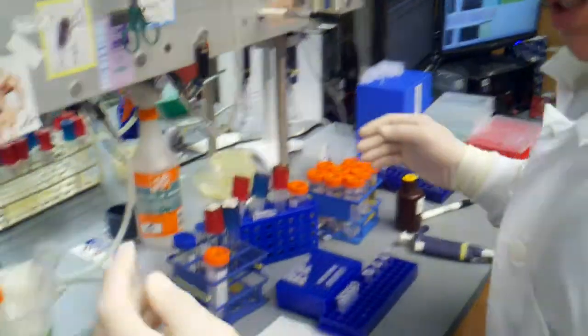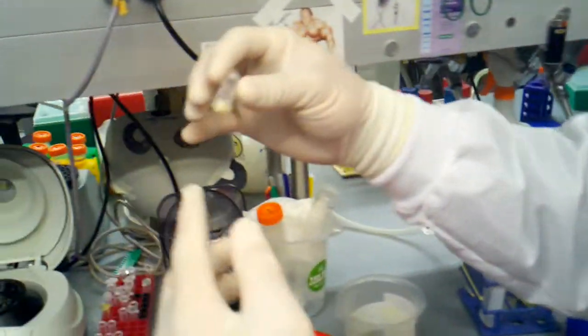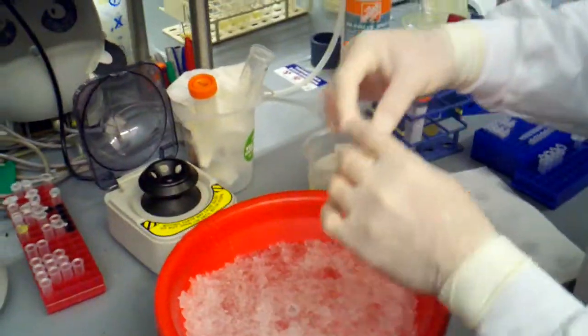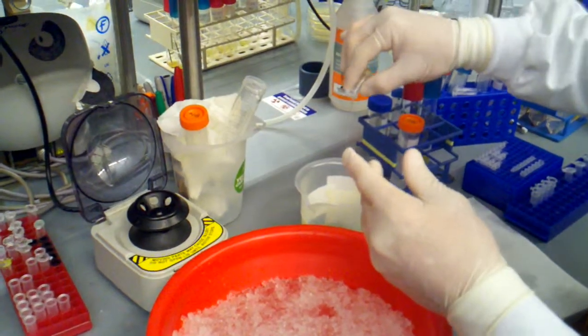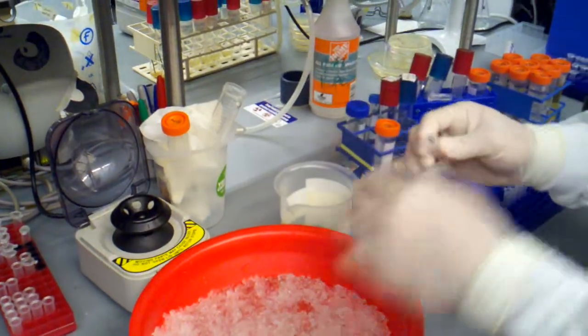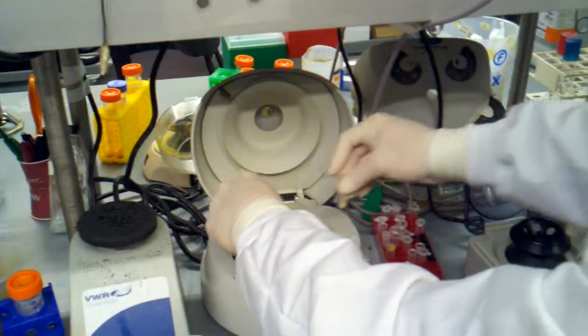And I'm actually going to do a second spin because you can see that our pellet could be a lot better. So it's going to get the majority of it off. And give it one more quick spin, 15 seconds.